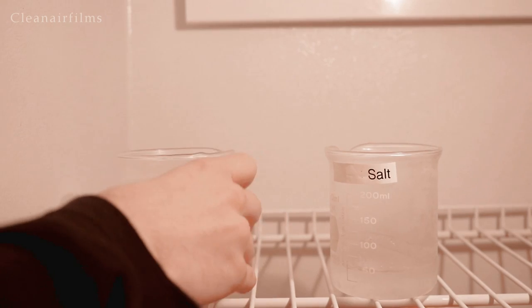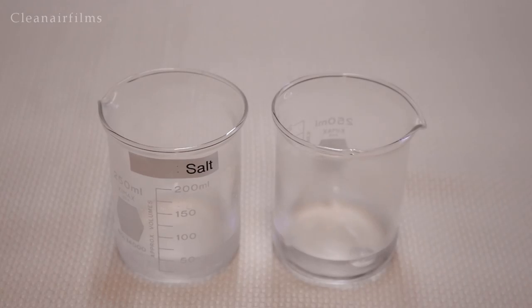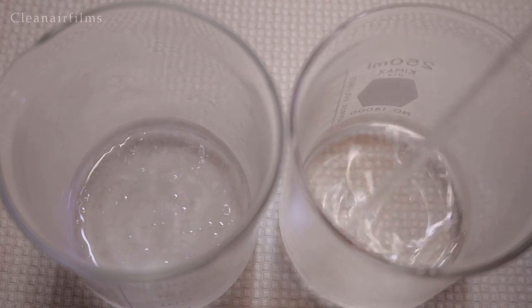It's been 30 minutes. Let's take them out of the freezer. They aren't completely frozen, which is what we wanted.